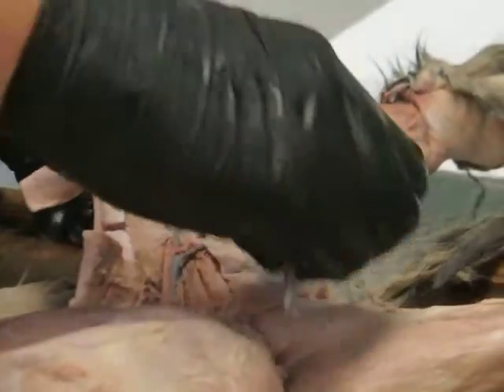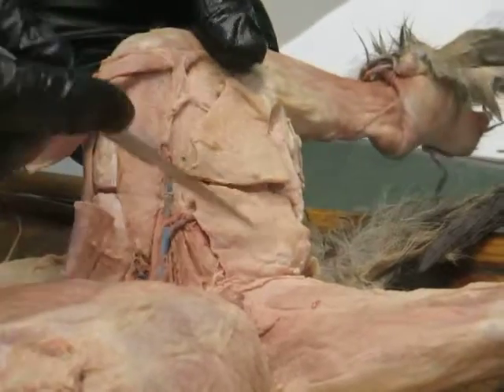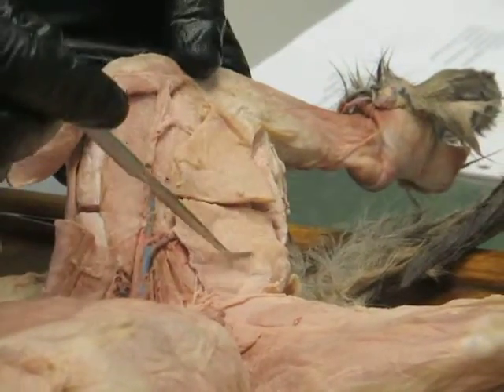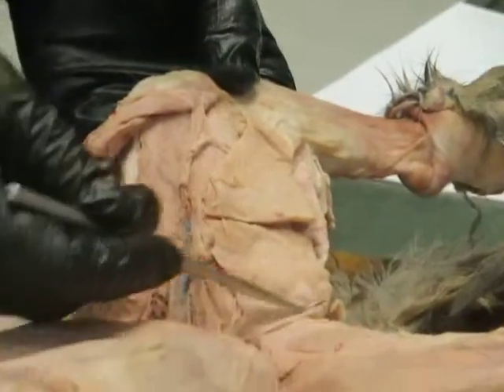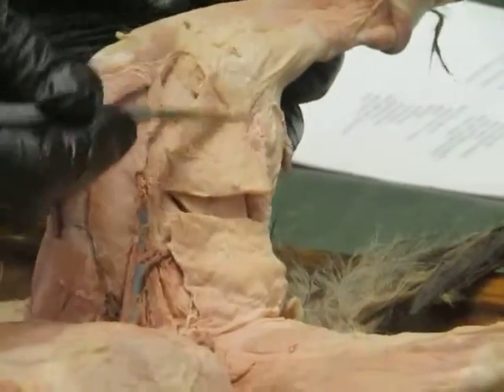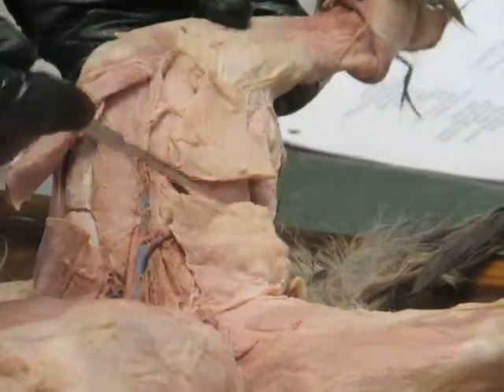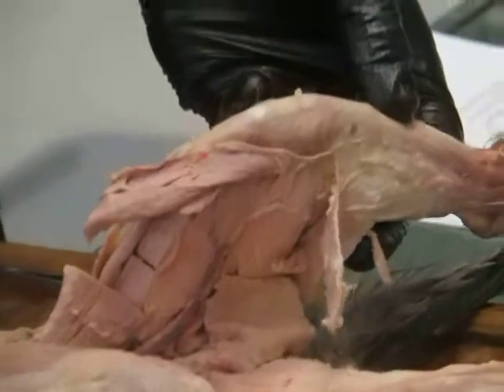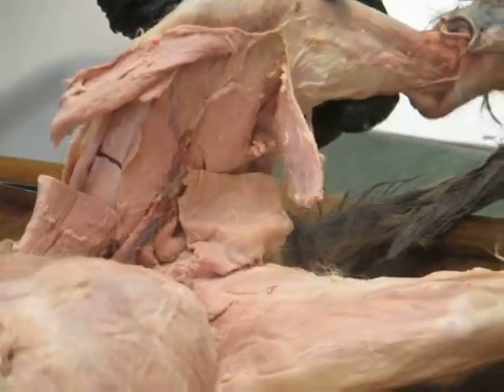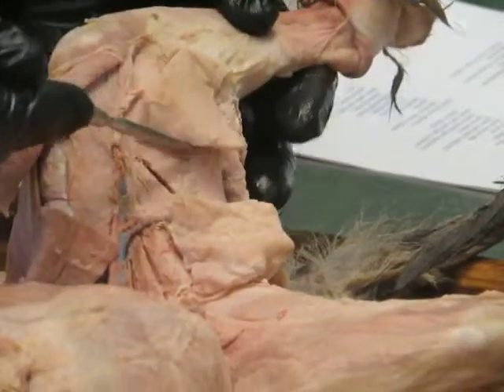And in humans, it's a very thin, slender, graceful muscle. Not so graceful in these guys. It's kind of big and flat. But that's the gracilis. It's arising here from the pelvic symphysis, inserting into this fascia over the shank. And what do you think the main action of gracilis is going to be? Adduction at the hip. Yep. Or adduction of the lower limb. It can actually also cause a little bit of flexion at the knee, but mostly adduction.